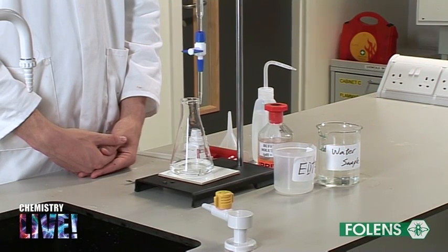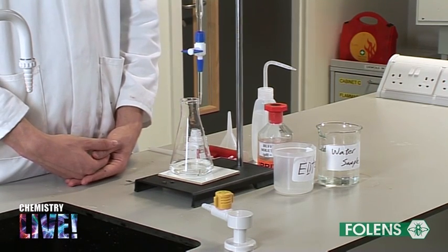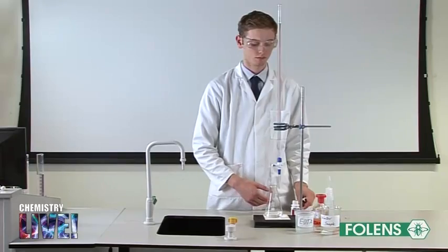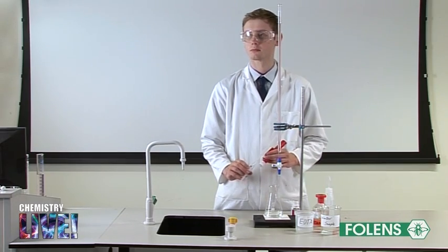The pipette, burette and conical flask have been rinsed out with deionized water. The pipette has been rinsed with some of the hard water sample and the burette with some of the EDTA solution.